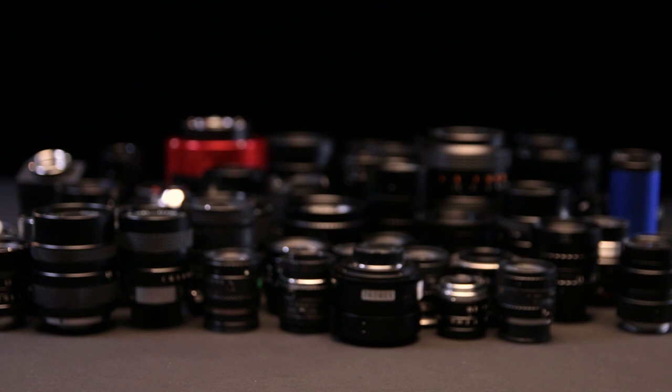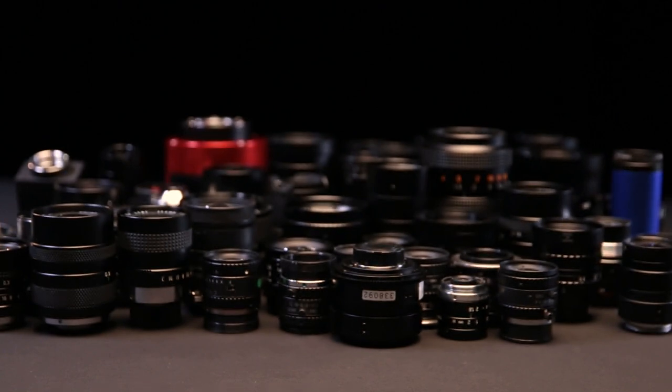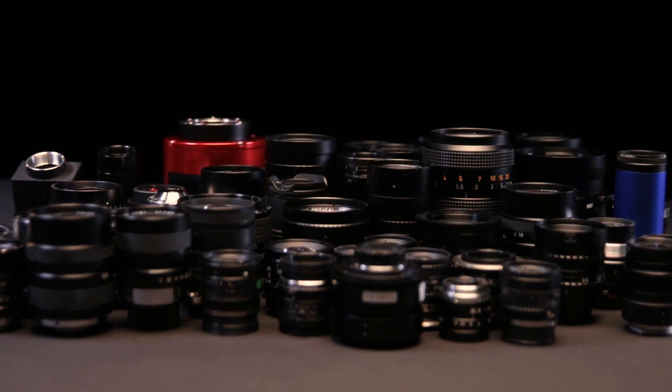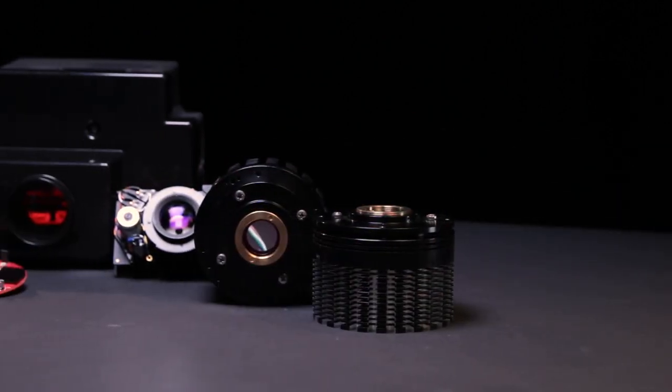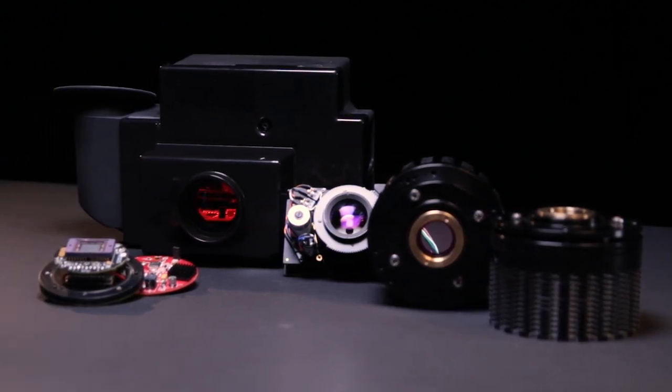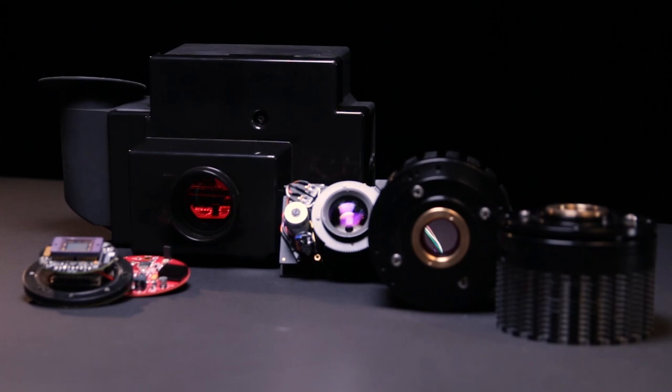One of the unique requirements for the camera in this system was our positioning of our filters. That is very challenging to do, and you cannot just go and get a commercial off-the-shelf camera that is capable of doing the things we need to do for our imaging system. So we had to bring that in house in order to incorporate the filter wheel mechanism into the camera. This way we can control the sensor we want and the cooling we want — putting it all together to optimize it exactly as the system needs for the applications it is designed for.